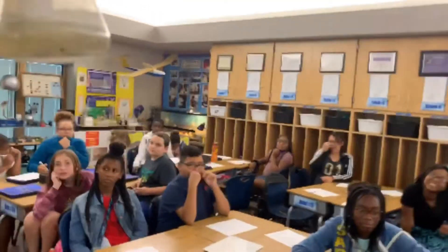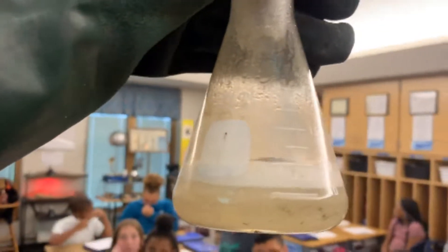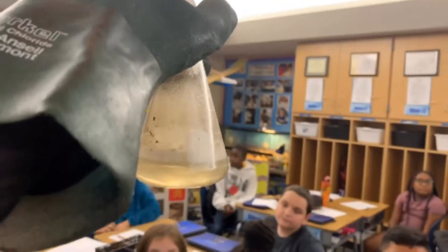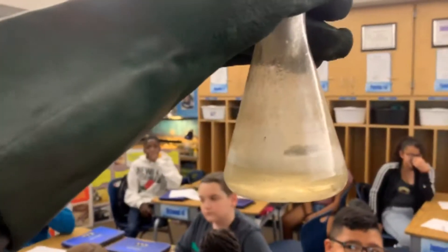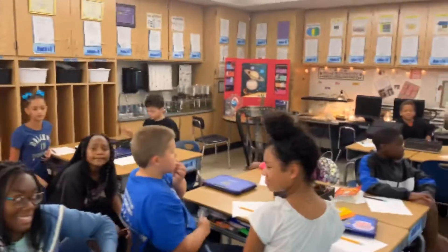Look at our aluminum foil — do you see it's almost gone? What's happening here is you're breaking apart hydrogen from hydrochloric acid, and that gas is going up into the balloon. This is a single displacement reaction and it gives off heat, so we would say it's exothermic. Good job, you guys.